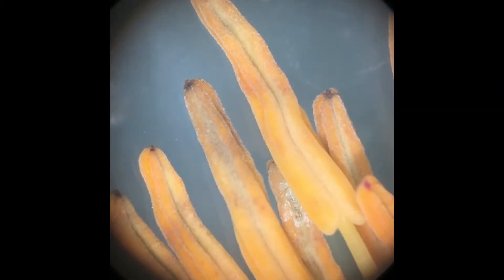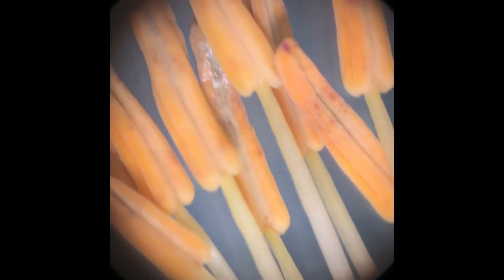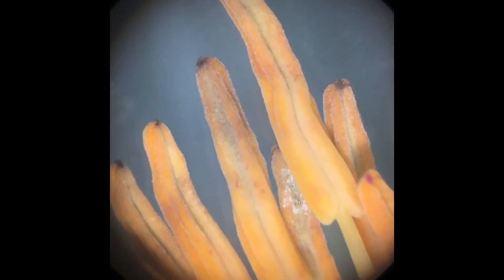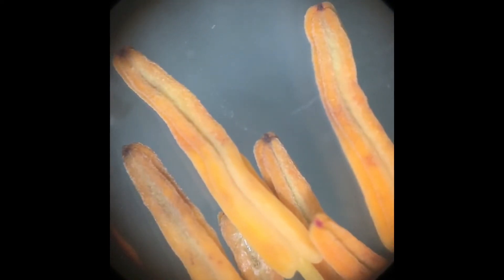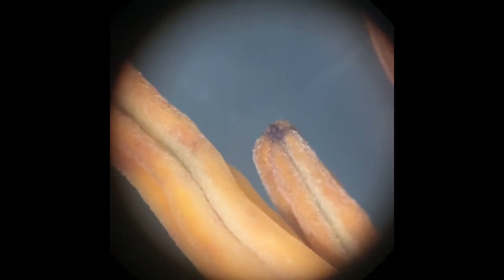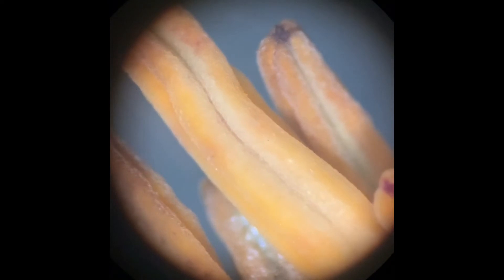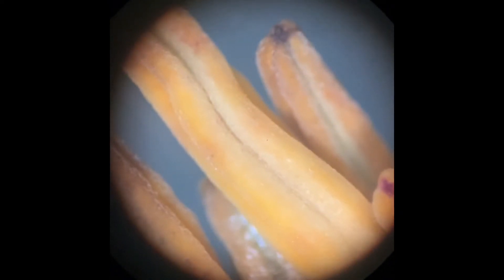We are currently looking at the anthers that are part of the stamen, and down here are the filaments that are part of the stamen. Here is a close-up look at the anthers where the pollen is located.